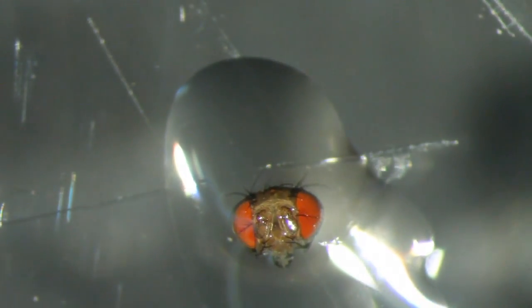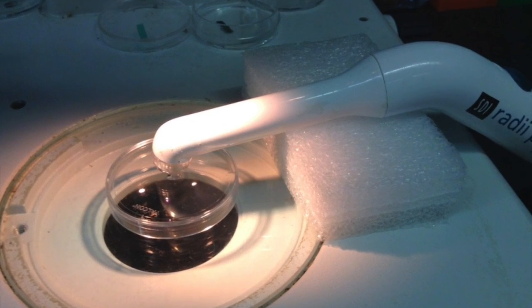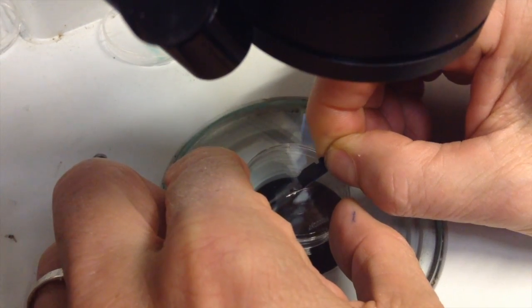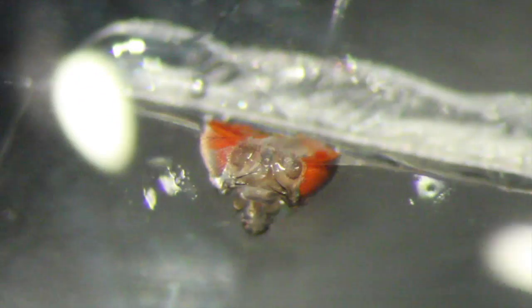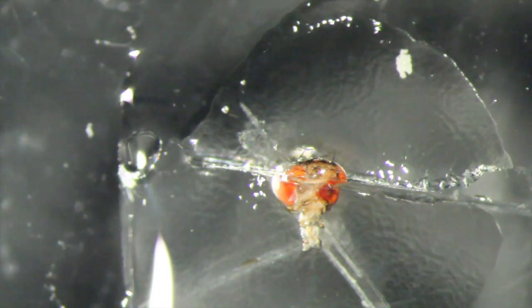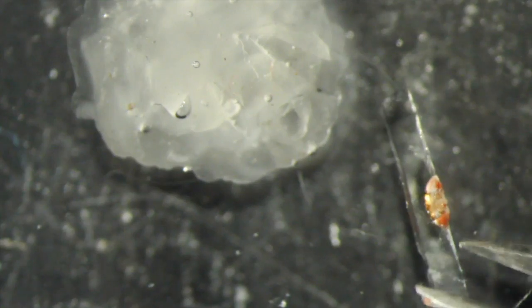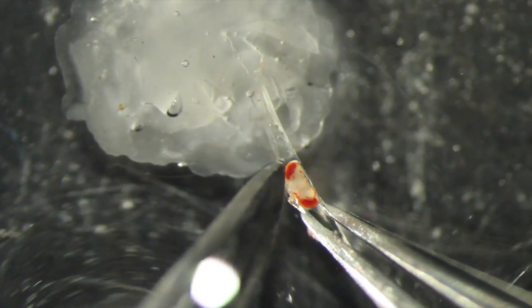Remember to protect your eyes with goggles. Then place a droplet of water on the resin and apply the curing light for one minute. After curing, wipe off the water with a tissue and apply a drop of saline. Under a microscope, orient the fly head and using a blade, cut through the joint between the second and third antenna segments with a swift and firm motion. Trim the cured resin chip and transfer to the holding dish. Insert the chip into the dental wax and the saline with the cut surface appropriately oriented.